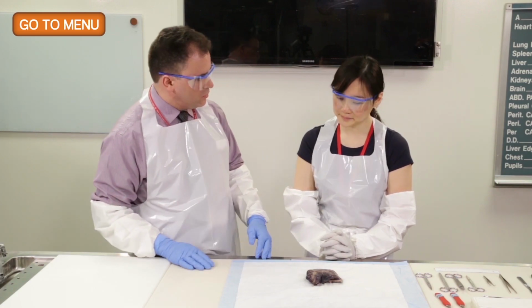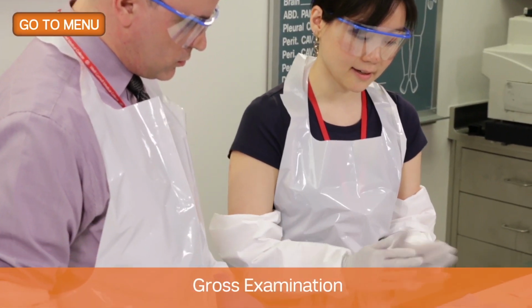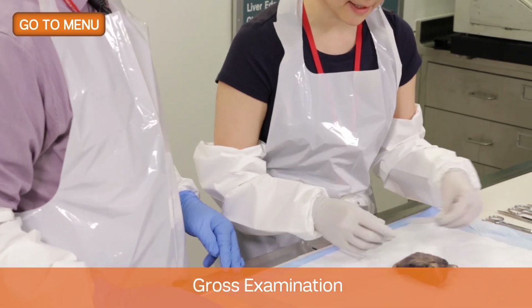So Esther, what would you like to do next? Well, first I would like to actually get a nice size of the lobectomy specimen.